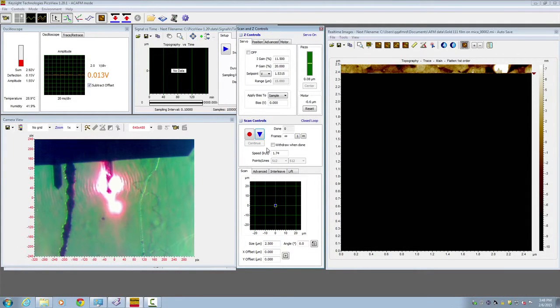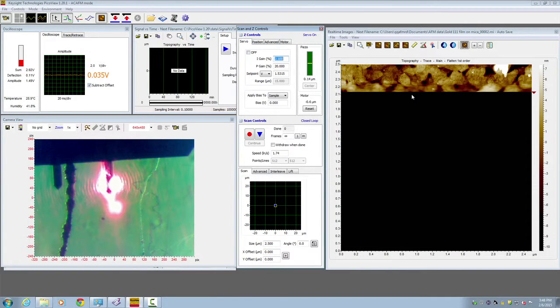In order to optimize the image, you could look at the image and then adjust the I gain and P gain. Let's see what happens when I reduce the I gain. When you reduce the I gain from 11% to 2%, we notice that the topography image starts to appear blurry. The integral gain, which is I gain, basically adjusts how sensitively the scanner responds to the up and down topography of the sample. So in order to have a high sensitivity, to have a crisp image, you need to have a high gain. However, what happens if your gain is too high?